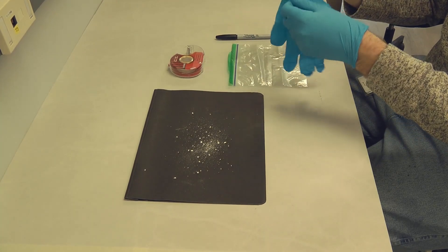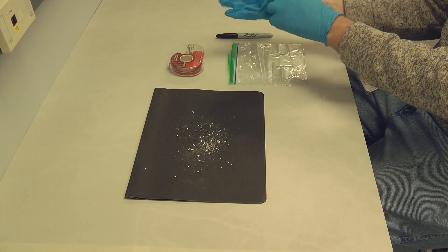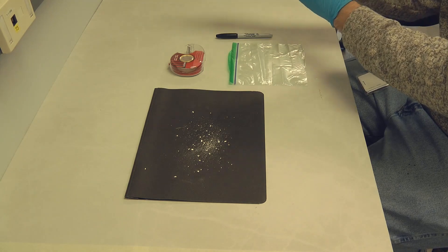Using several microscopes we can identify 20 to 40 different materials and it is very important that your sample that you collect is of good quality.